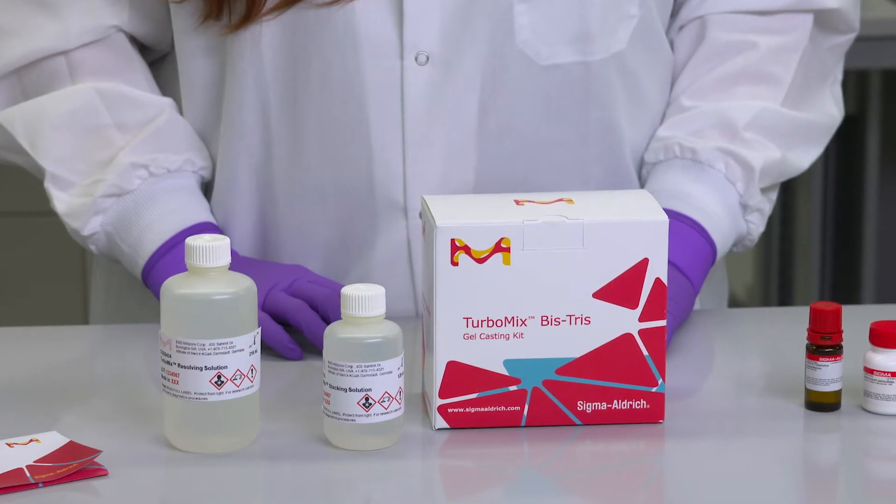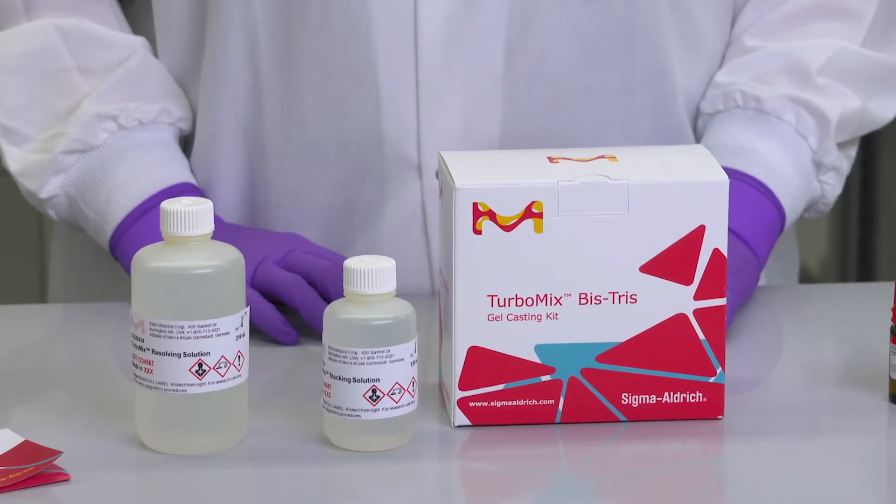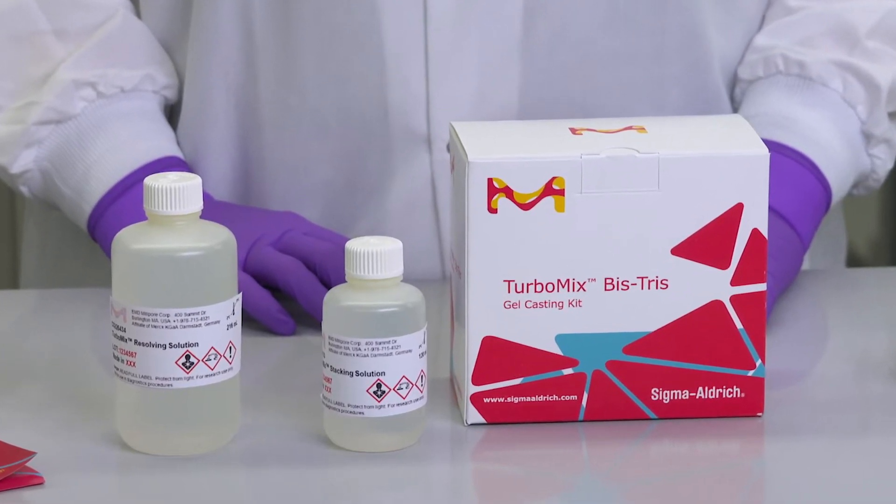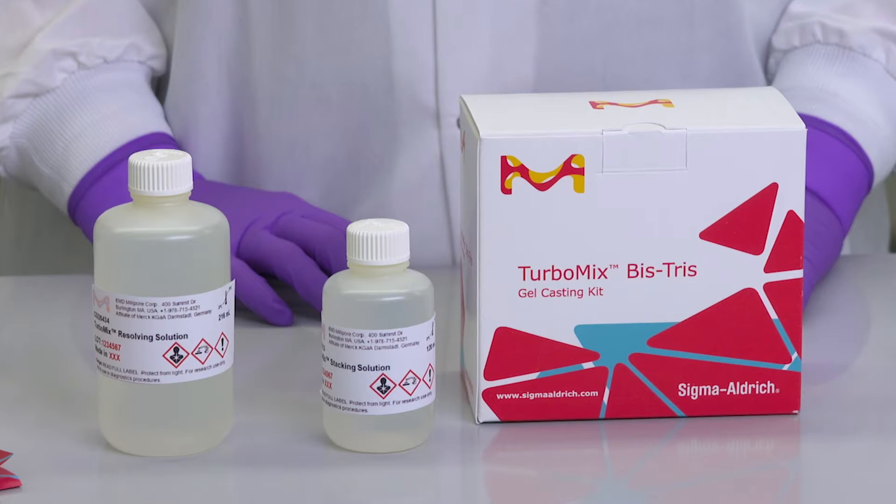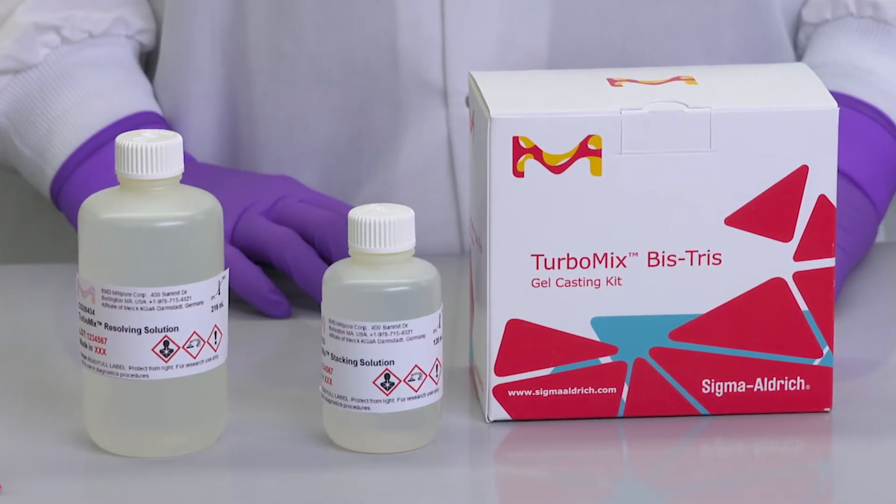The gel casting process takes less time with TurboMix by using a quick cast protocol in which the stacking solution is poured immediately after the resolving solution without waiting for polymerization. I'll demonstrate the quick cast protocol now.